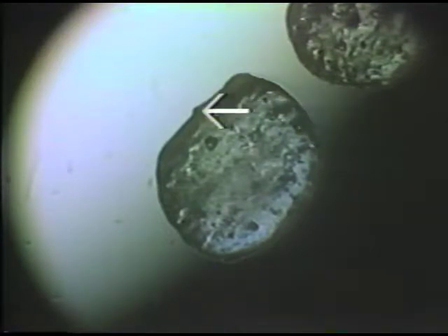Now, if you look at the shadowing on these particular mineral grains, you can see that one side of the mineral grain is bright, another side of the mineral grain is dark. Now, we look at the shadowing on the grain with respect to the shadow within the field of view. Now, in this particular case, with our high index oil and with the crystal of lower index, the shadow on the mineral grain, which I'm pointing to now, is opposite to the shadow in the field of view.